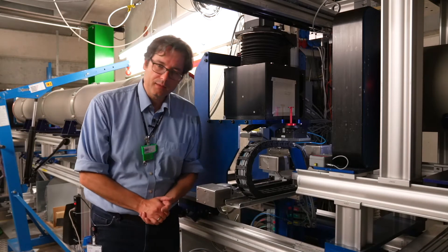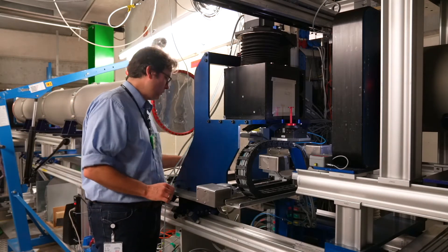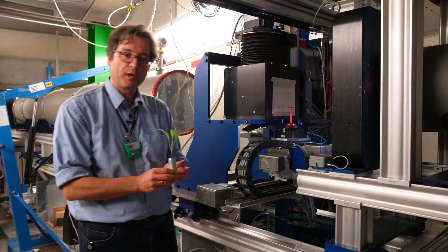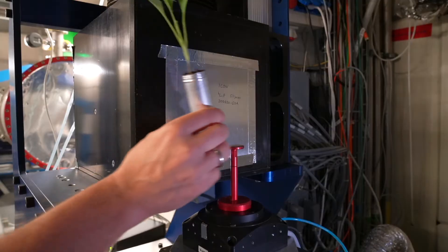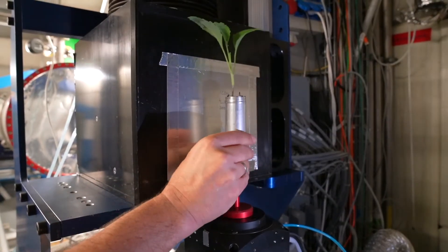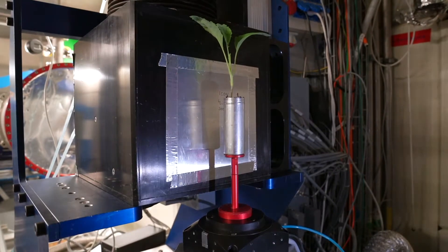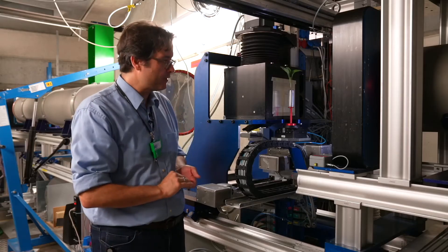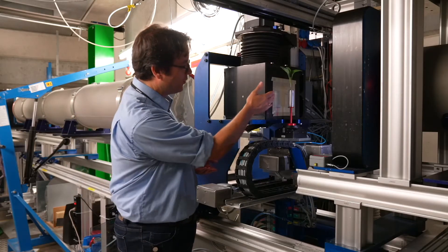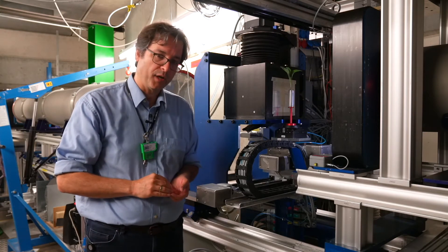In the standard approach, a sample — like in this case this plant — is positioned in front of a detector. A part of the radiation is attenuated by the sample and then registered by the detector behind it.